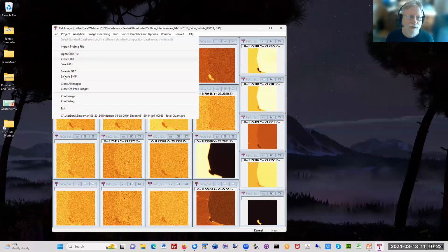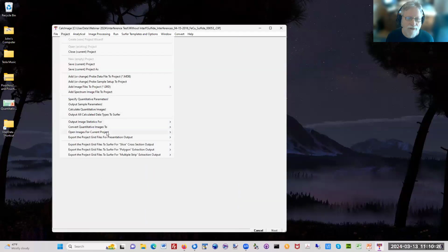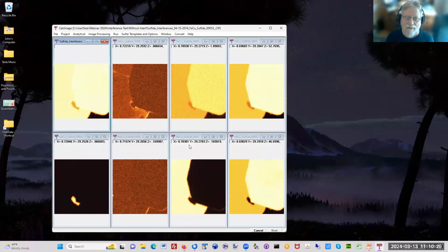If I close all these images here and open up just the quant images here, you'll see that this is the molybdenum, right? Where's the molybdenum here?